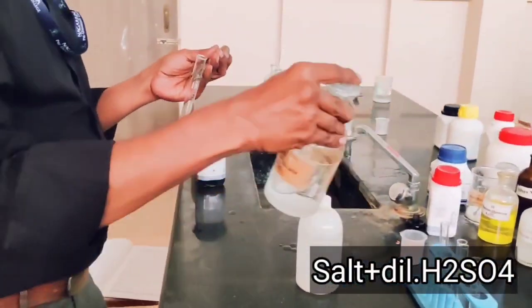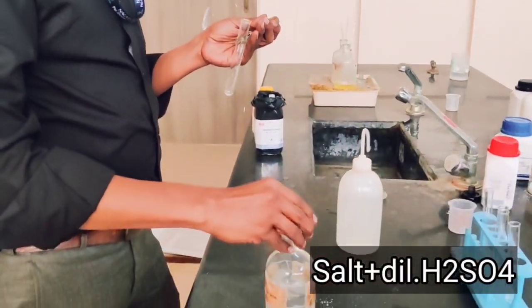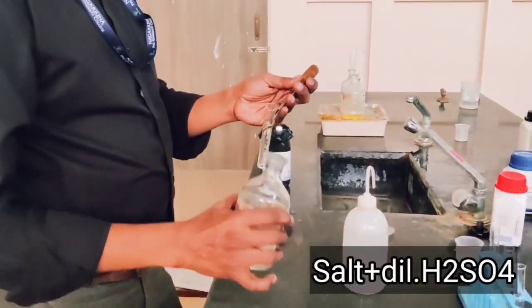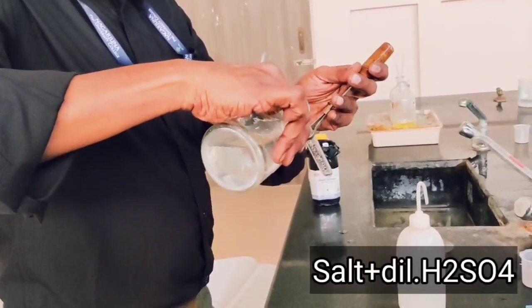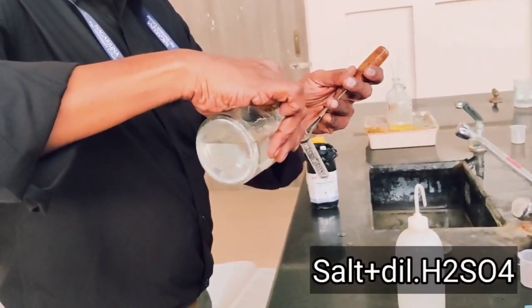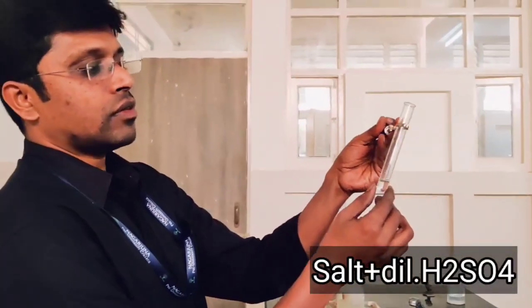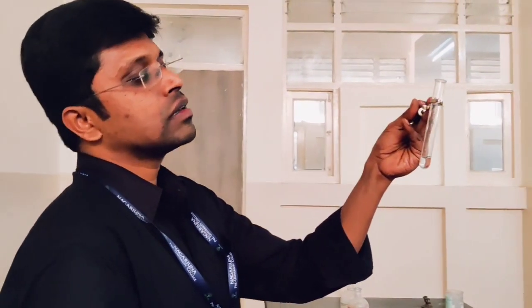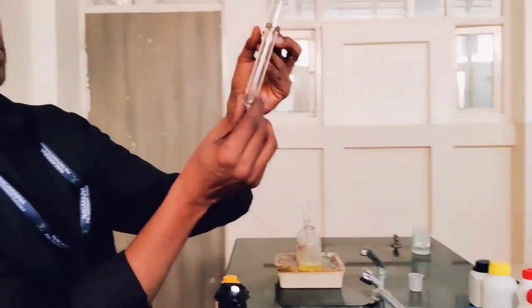Before adding the reagents, we have to shake them for uniform concentration. For the first group, as we know, there should be brisk effervescence if carbonate is present. We can see no brisk effervescence, so we can conclude that in the given salt there is no carbonate. Therefore, the first group acid radical carbonate is absent.